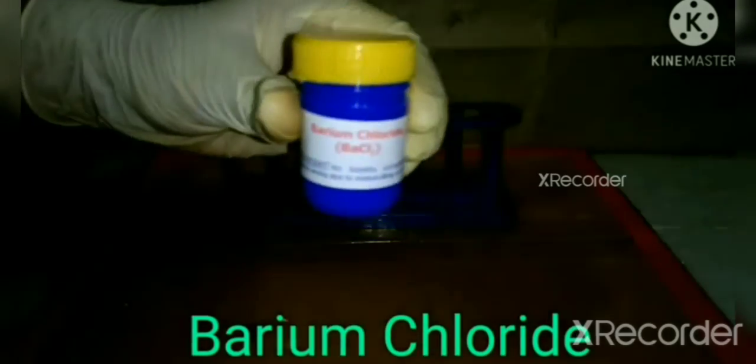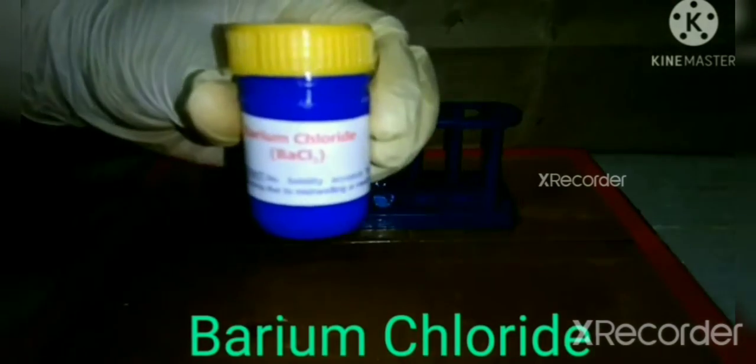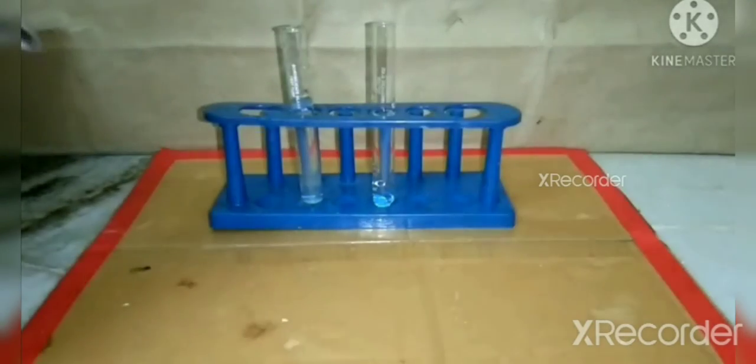Now we are taking barium chloride and again we will put it in the second test tube and make the solution.